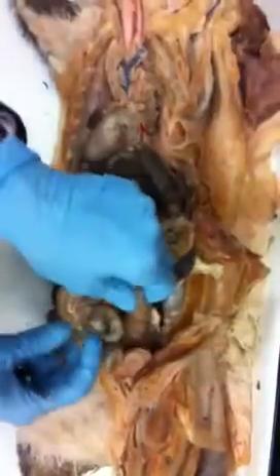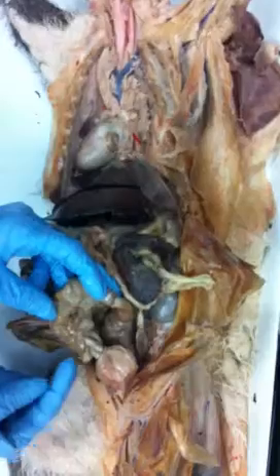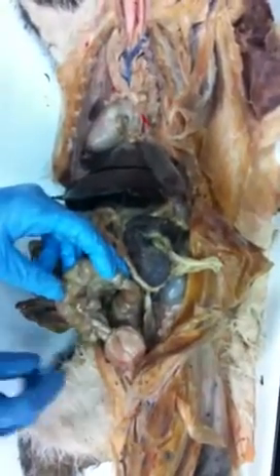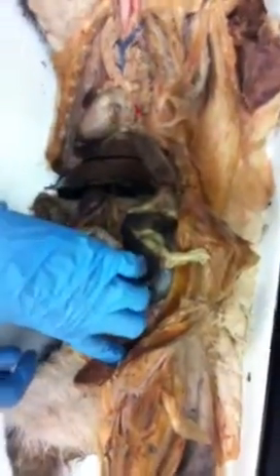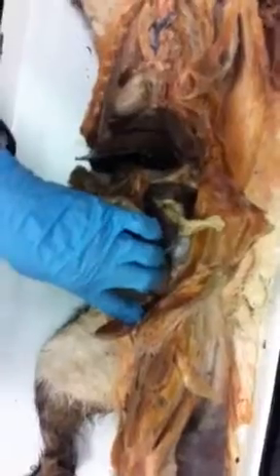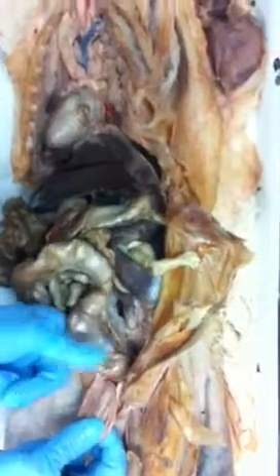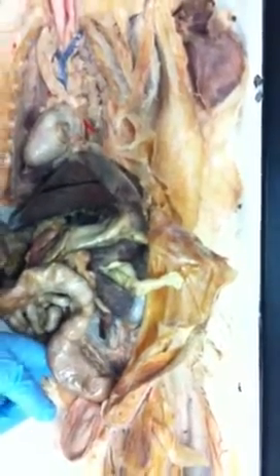And if we could put this in the proper orientation, it would be something like that. So this would be your ascending, your transverse, your descending. Okay? And then that all comes down here, way down in here, and that's the rectum. It's for storage and compaction of the waste prior to elimination. That part down here is actually firmly attached to the back body wall by a mesentery membrane down here. This has to be opened a little bit more to see it. But that's just called the mesocolon, and it's a mesentery and it's holding the colon.